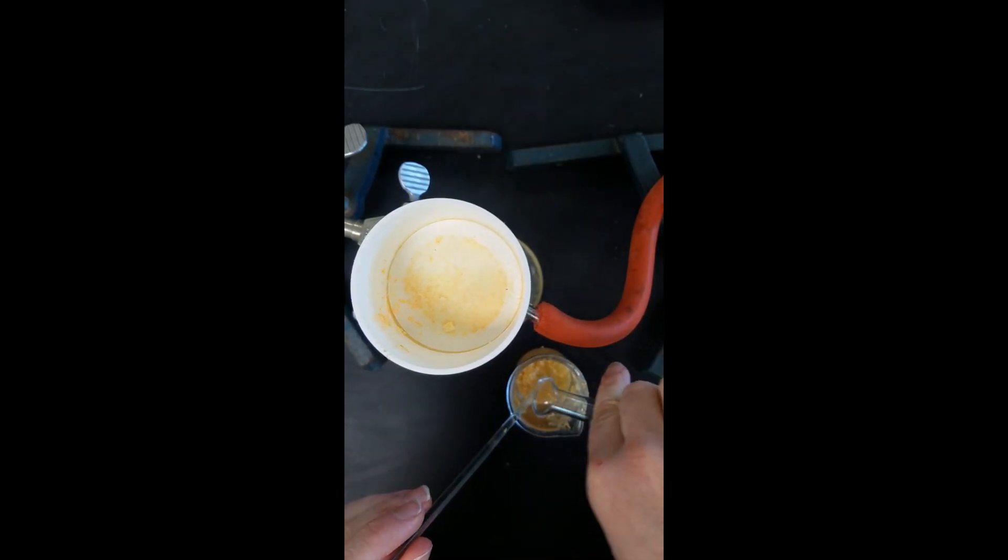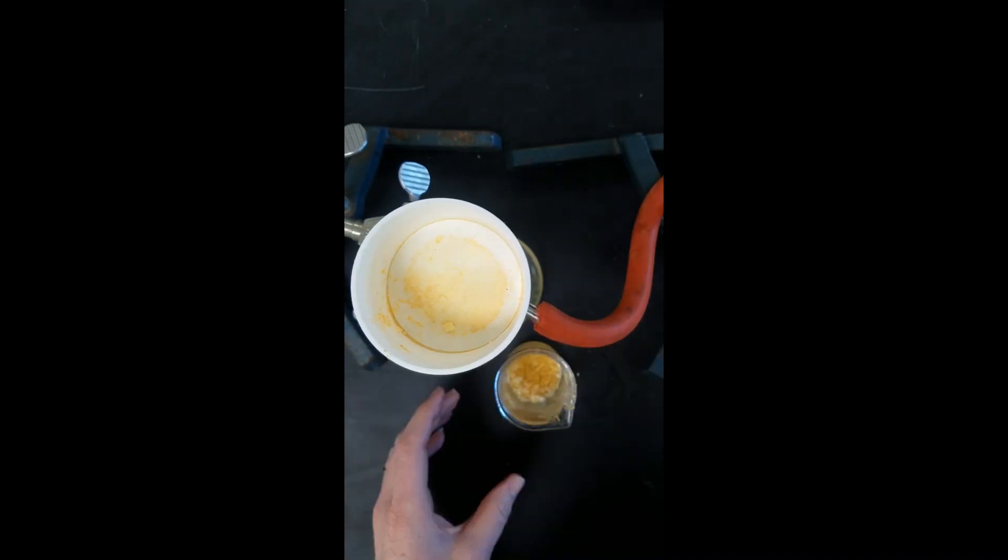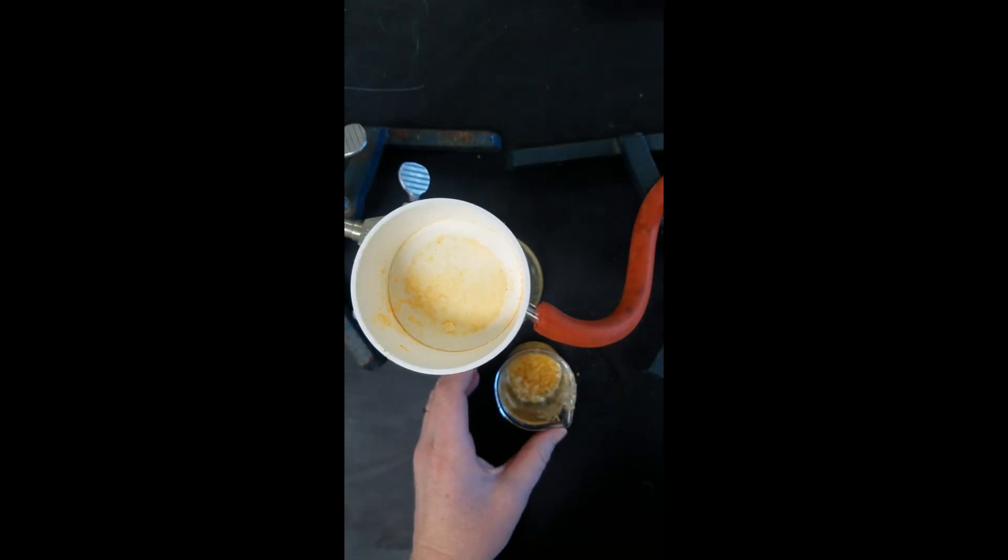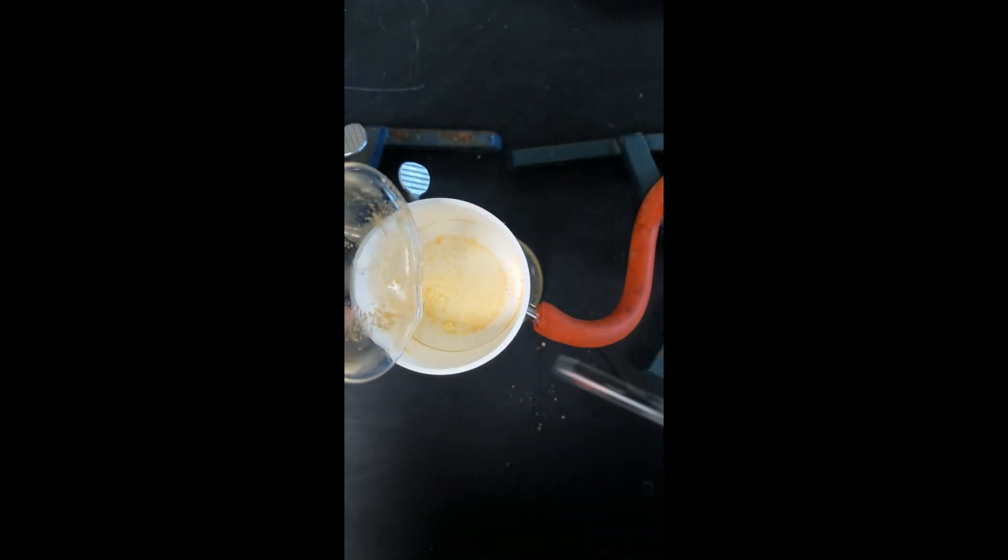This is the last addition, the third addition of the petroleum ether, and again we're going to mix for another minute. Filtering this for the last time for our Ruffles.